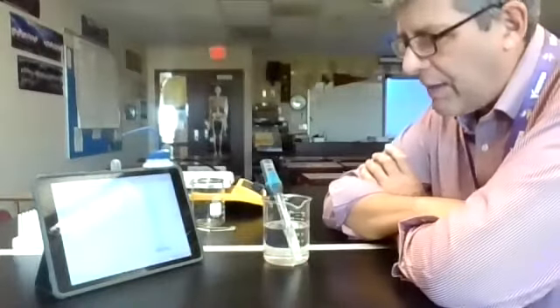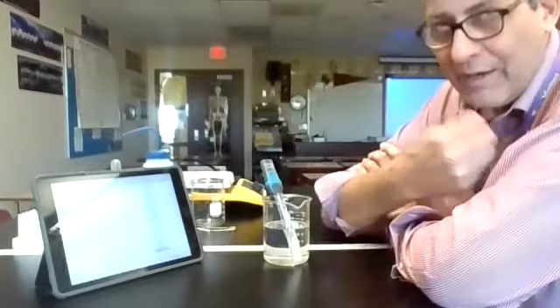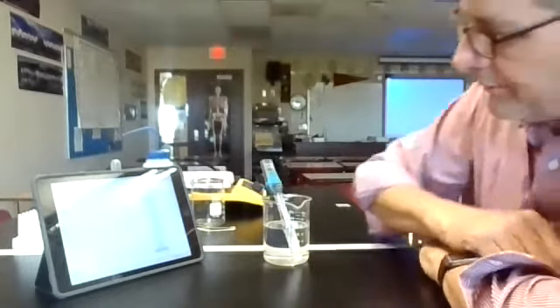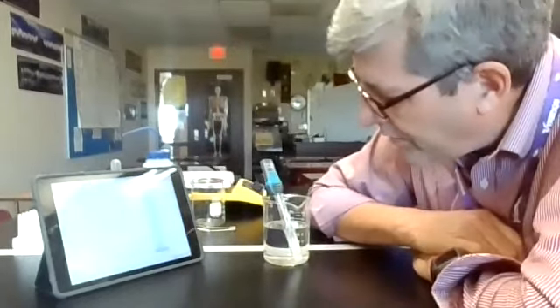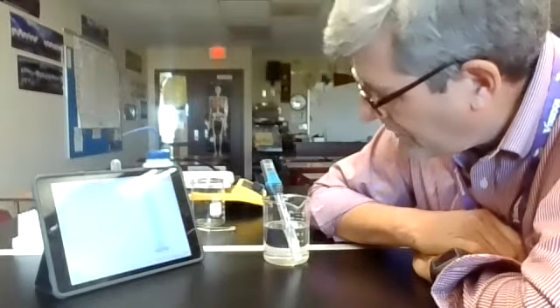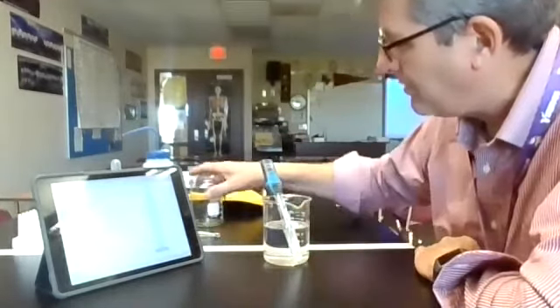The first part of the lab, heating it up, takes quite a while. Cooling her back down, because I always like to go with ice instead of just water, does go pretty quickly, and we really get a nice little plateau at the very end, and you can see it starting to really level out for us. And we're at about 24 degrees Celsius. And once we get down to about room temperature, that should be about it for us. I would think another half a minute, maybe a minute at the most.